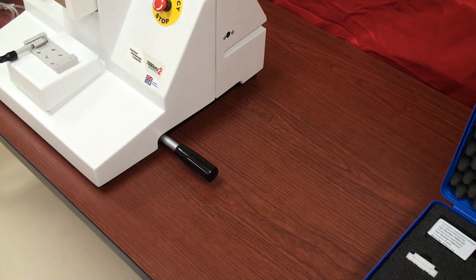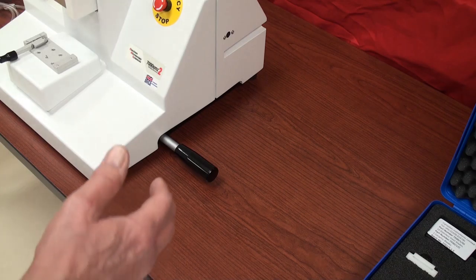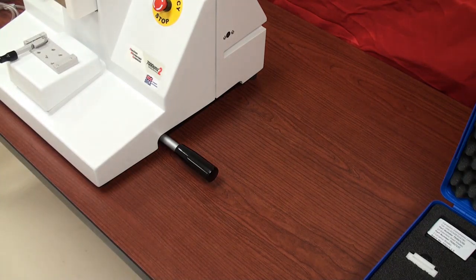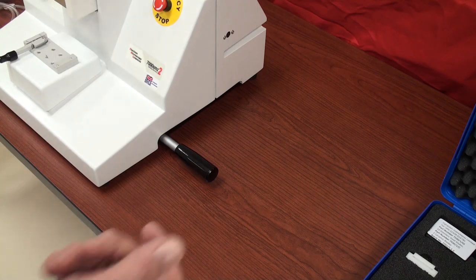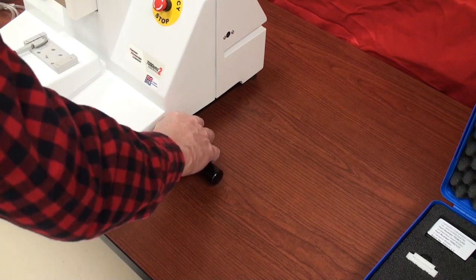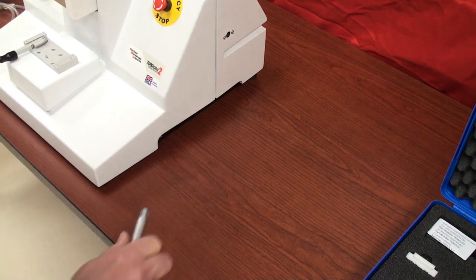It's best to have a two-person carry if you're going to move the instrument around — it's quite massive and it's safer for both you and the instrument if two people are involved. Once the instrument is where you want it, you simply unscrew the handles and store them until you need them again.